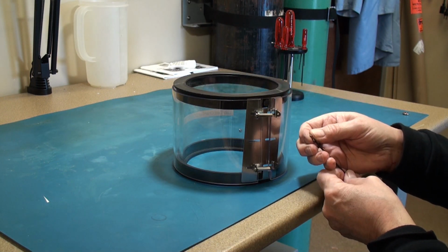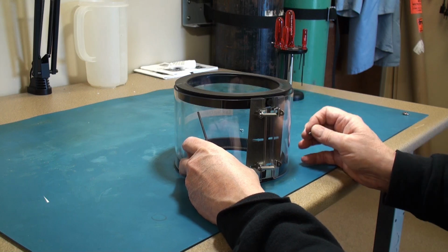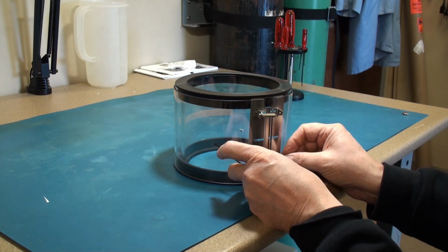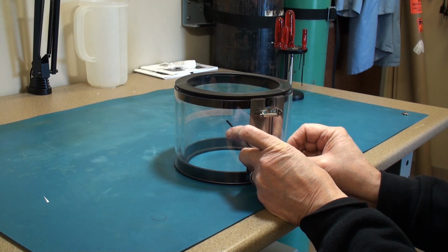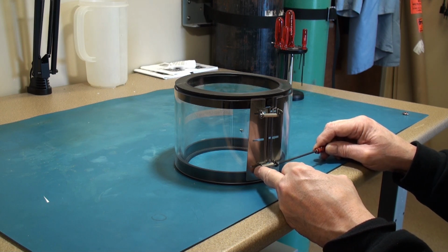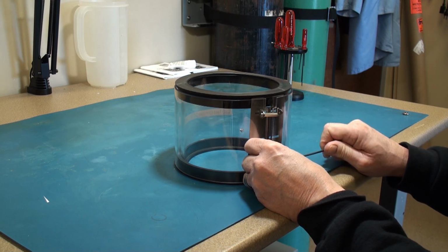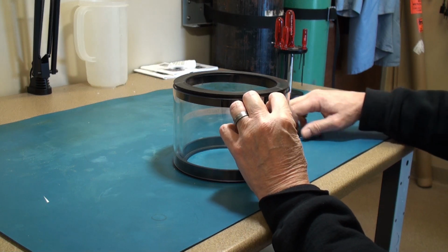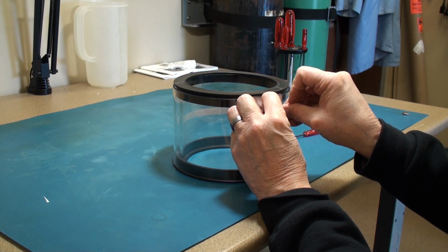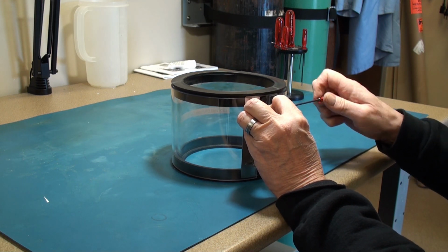And then the first step is to make sure that the aluminum bracket is lined up. Put the hex head screw through the bottom or the top, doesn't matter, whichever you want to start with. And then get a few turns started. Then you repeat with the top.